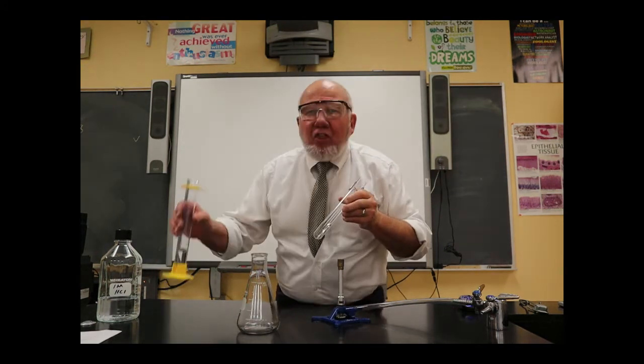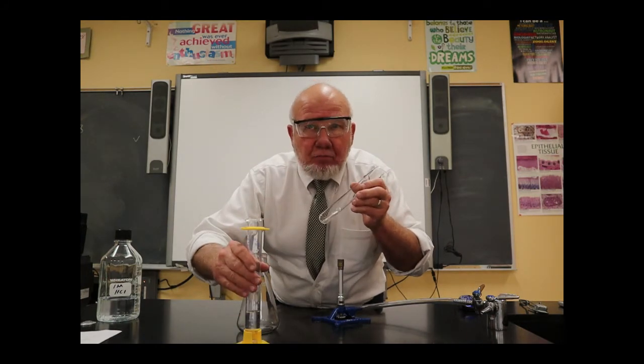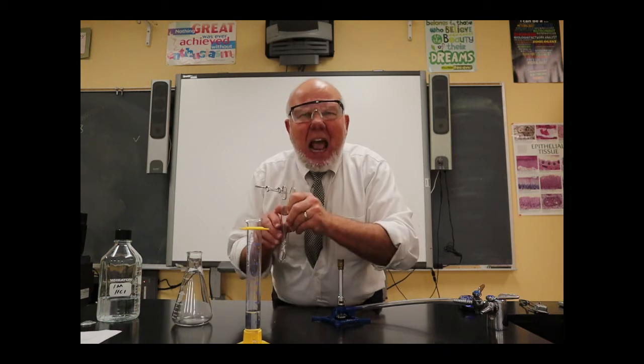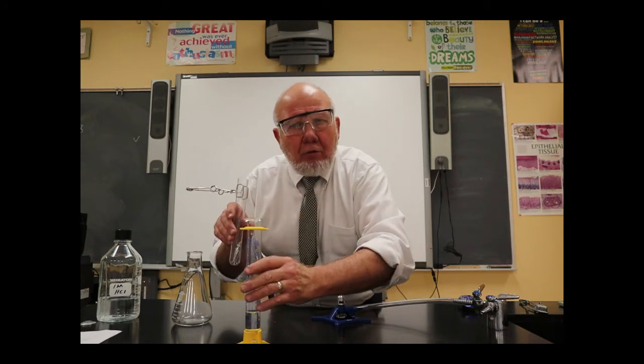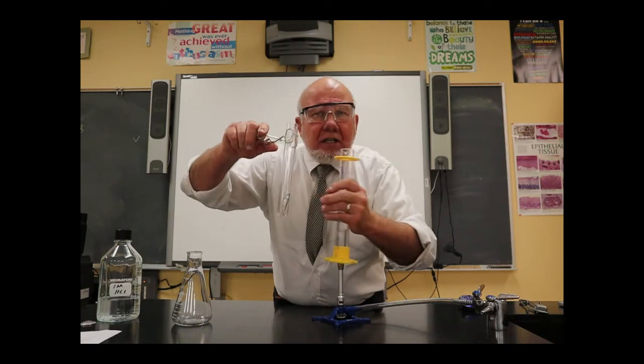I've got 30 milliliters of hydrochloric acid. Now, the acid, as you probably have seen in movies maybe, acid reacts very vigorously sometimes with metals. And so I'm going to pour this in here. I've got it in a test tube.